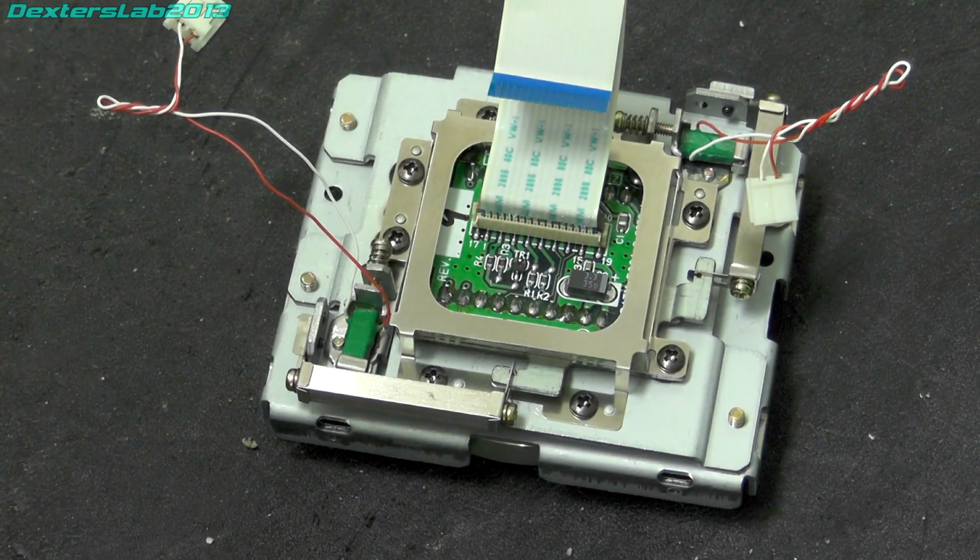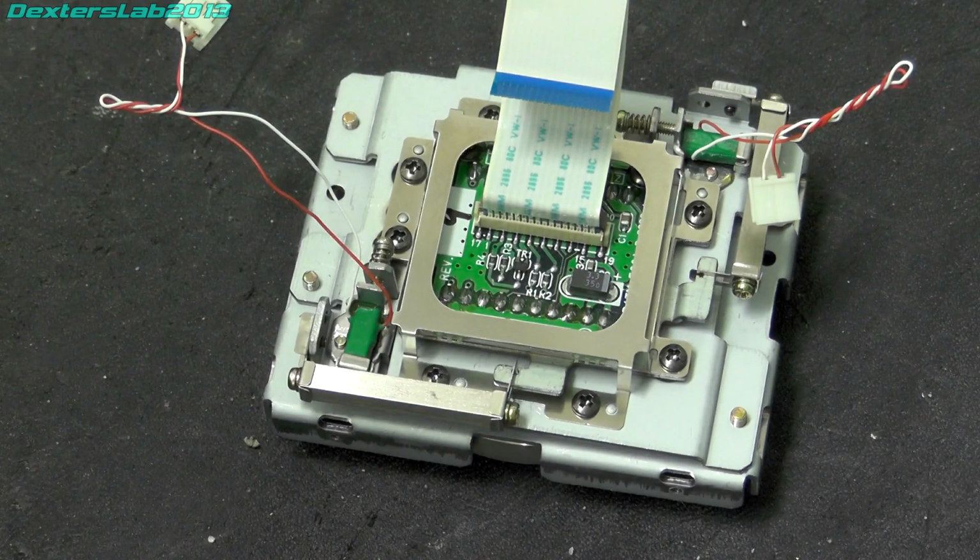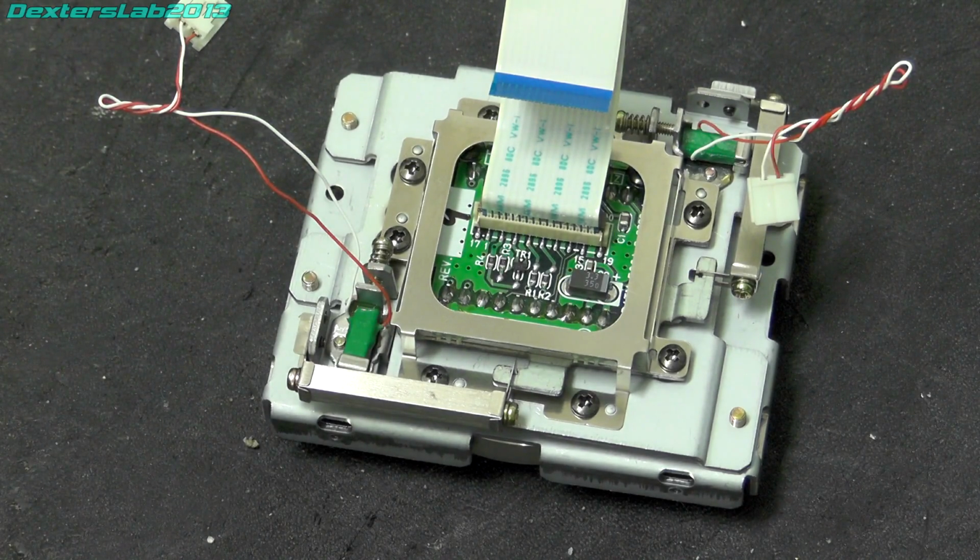So I think what I'm going to do is just reassemble this. I'll pop it on the shelf for a few months and see whether I can actually turn up one of the interface cards and the software. I think the chances of that are pretty slim though, because it'd be nice just to try it out and see what it can do.